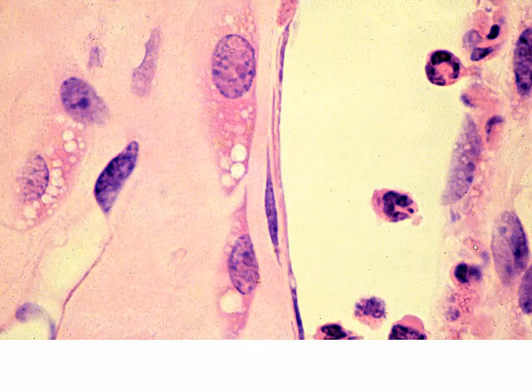Once again, we have a lot of cells to deal with here, possibly a fibroblastic nucleus that's present, but now you can see all of the bubbles in the cytoplasm of this macrophage, quite a few macrophages present here, and we have some leukocytes, white blood cells, that are going to be present in this field. You can see the multiple lobes of the nuclei, and that's how we identify those. Not going to spend a lot of time talking about them right now, simply because we'll get to them when we talk about blood.